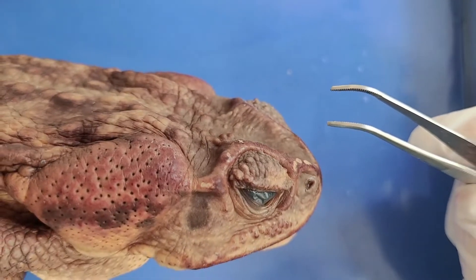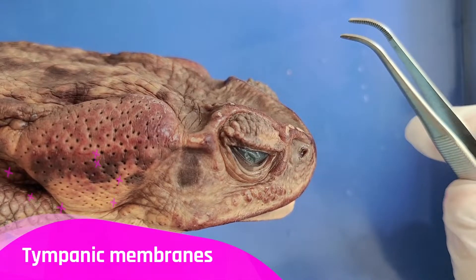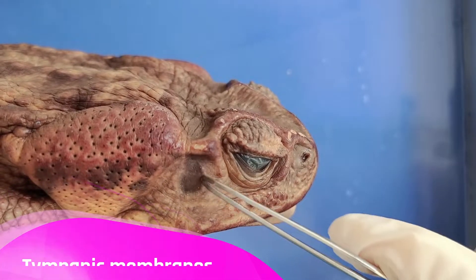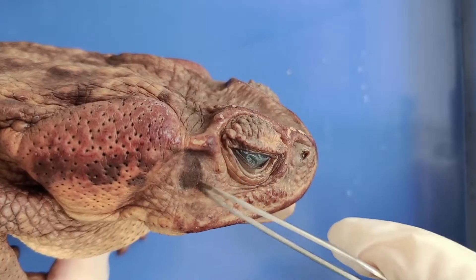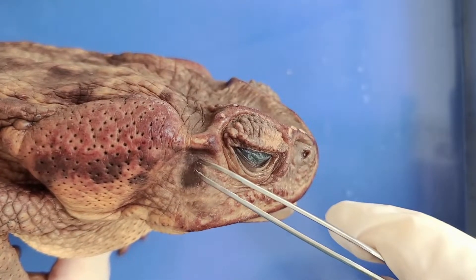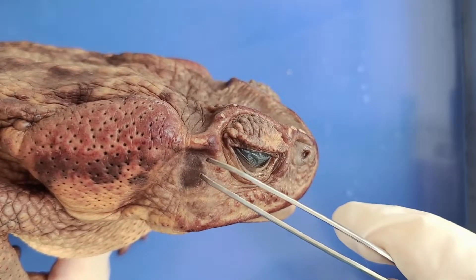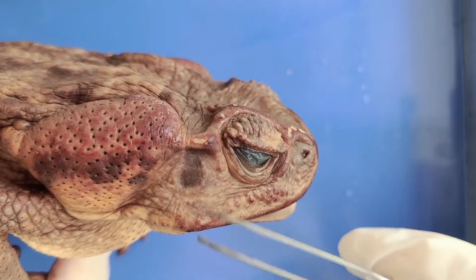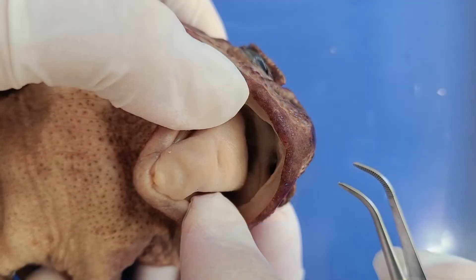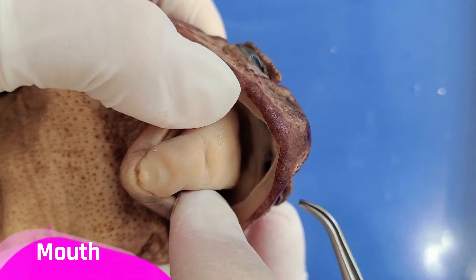Instead of ears, toads have these things called the tympanic membrane — this round area here — which vibrates like an eardrum and allows the toad to hear both on land and underwater.